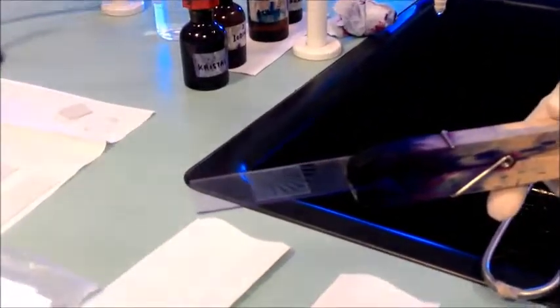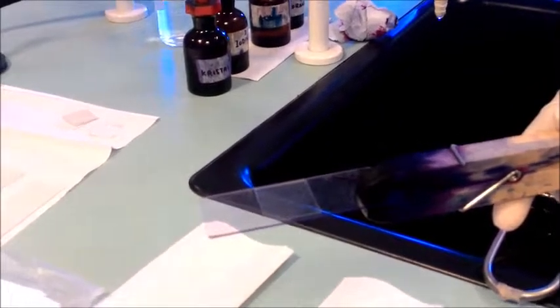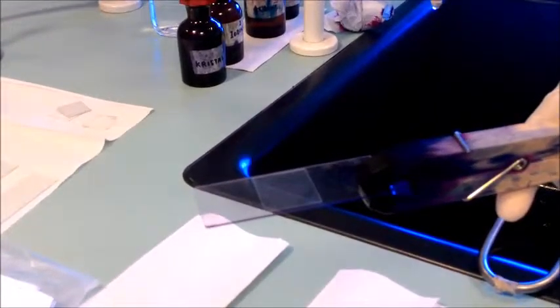After we are done, blot the slide with tissue, place a cover slide onto the slide and then observe under the microscope and then repeat the procedure using a different bacterial culture.